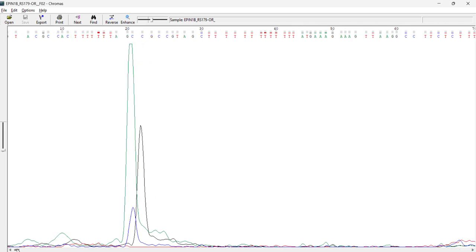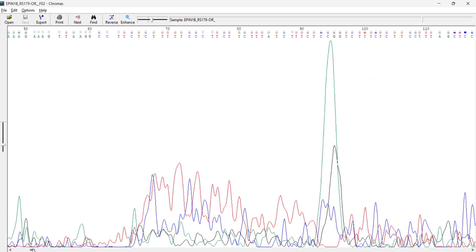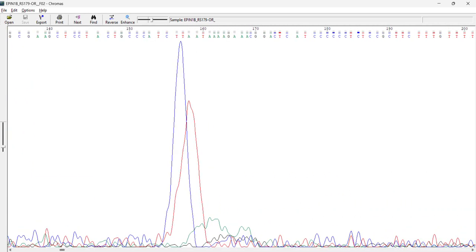So if we drag it to the right hand side, you will see what type of chromatogram we have got. So you can see a lot of noise. Noise means nothing but a mixture of peaks, right? It is not very clear. Basically everything is overlapped. So of course there is nothing more than heterozygous. We have homozygous and heterozygous. I don't know what is quadrozygous, right? If you know, let me know if you discover something.